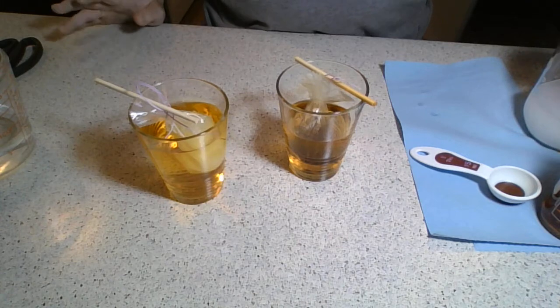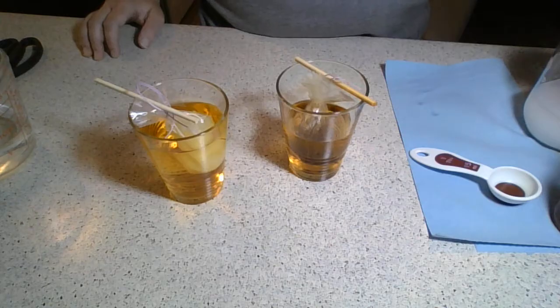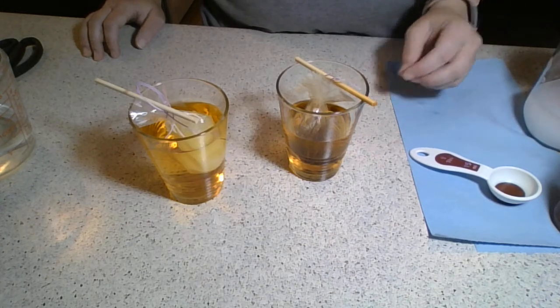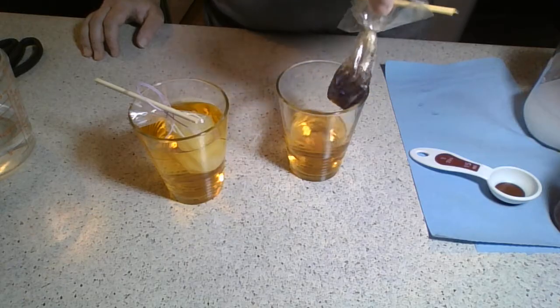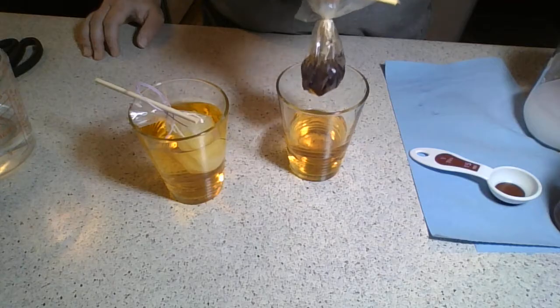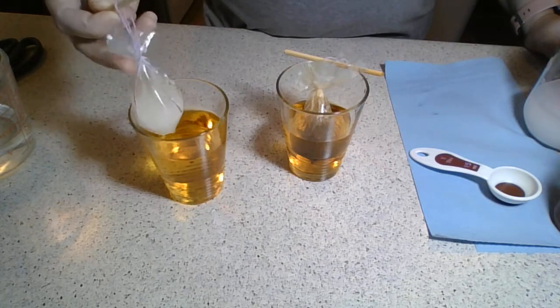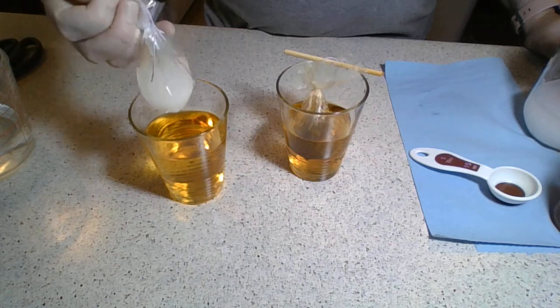Here's an extension question: if I was going to store some iodine somewhere, would I want to put it in a plastic bag? Maybe, maybe not. We're looking at how the iodine or the starch moves through a semi-permeable membrane. After sitting for a little while, the starch solution inside of this bag turned purple. Iodine is an indicator for the presence of starch, and it started off looking like a milky white substance inside of our starch cell, with just an amber color in our iodine glass.